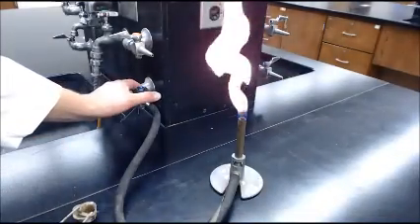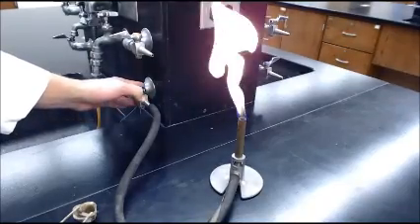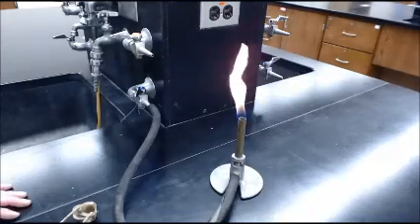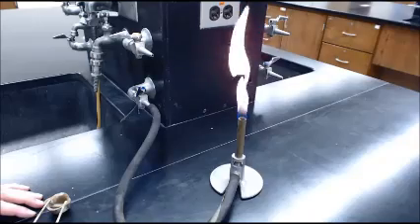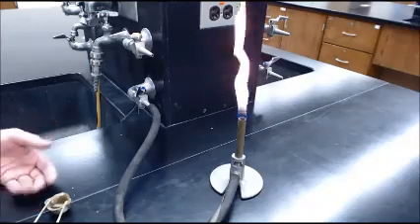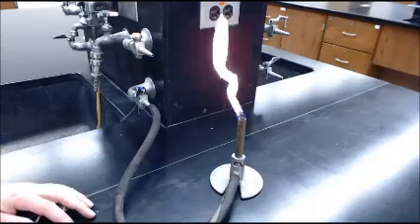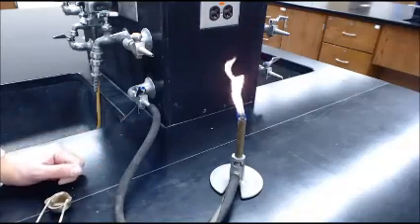It's a bit too big. You can come back to the valve and we can start to shut it, and that will reduce the amount of gas that's there. This is a bright flame but it's not actually burning the gas very well — this is called incomplete combustion. There's not enough oxygen, and so there's a lot of particles still unburned that are causing the yellow color.